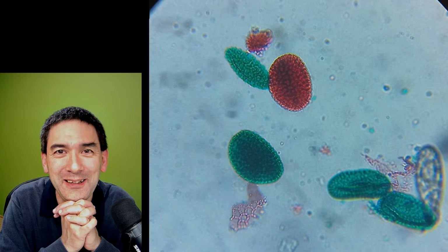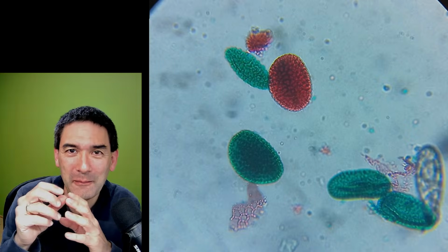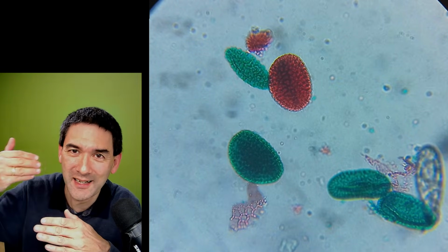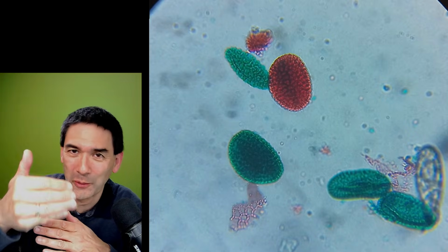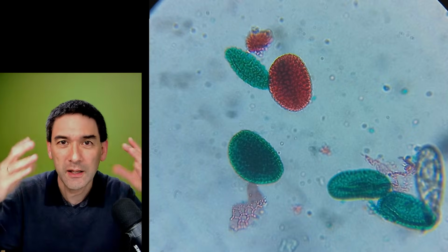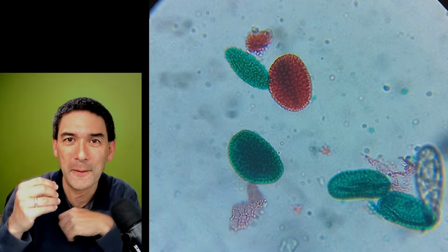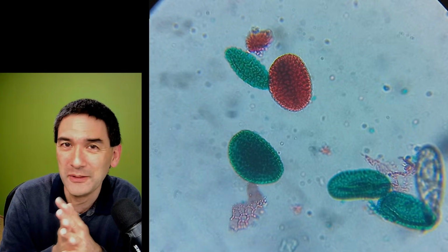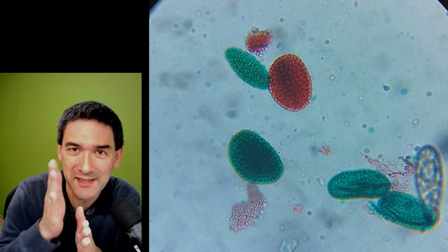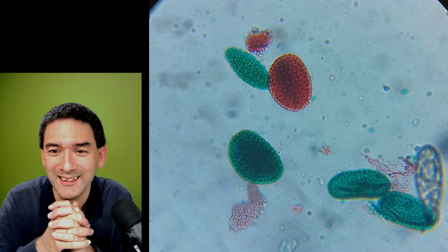I'd like to actually take an earthworm, a small worm, prepare it and then slice it up, take pictures of every slice and then kind of fly through the worm. I don't know how to explain this, but have a movie to see the different organs of the worm, because a worm is nice and long. But you need a microtome for that. You need to properly embed it and so on. It's possible to slice objects up, but that's a lot of work.